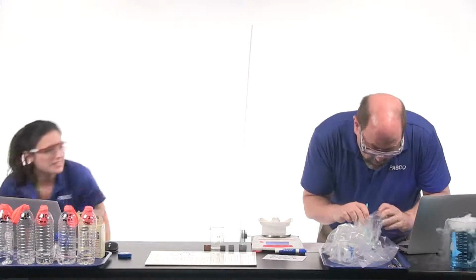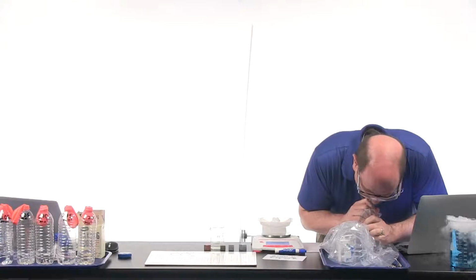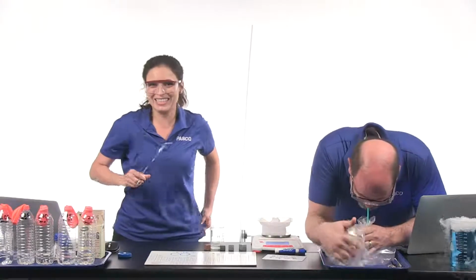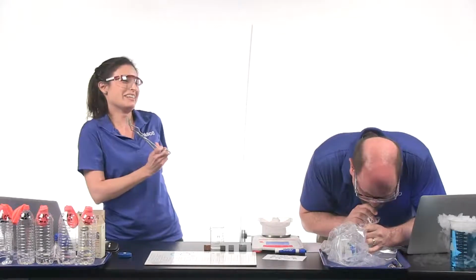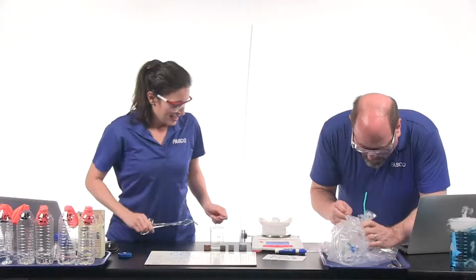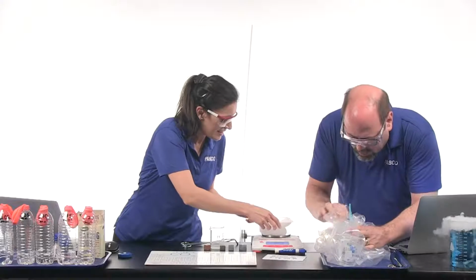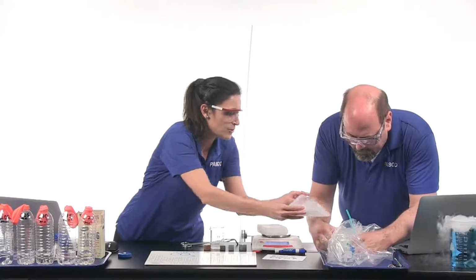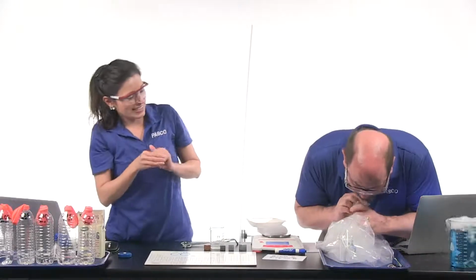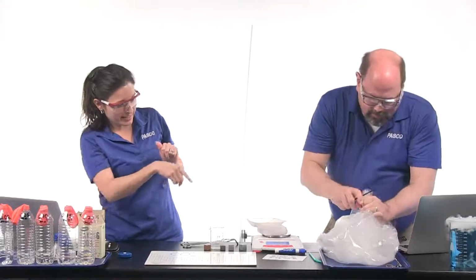Okay. Ready? Yep, just a second. Whenever you're ready. I had to close that dry ice because I didn't want us to suffocate, because we don't want to replace all of the air in the room with carbon dioxide. Okay, I've got it down pretty low. Great. I'm going to take a little bit more out after we put this in. Okay, you ready? 1, 2, 3. Nice. And it's in. Okay, let me just take a little out. Don't suffocate. Okay, so Roger's going to seal that bag up tight.